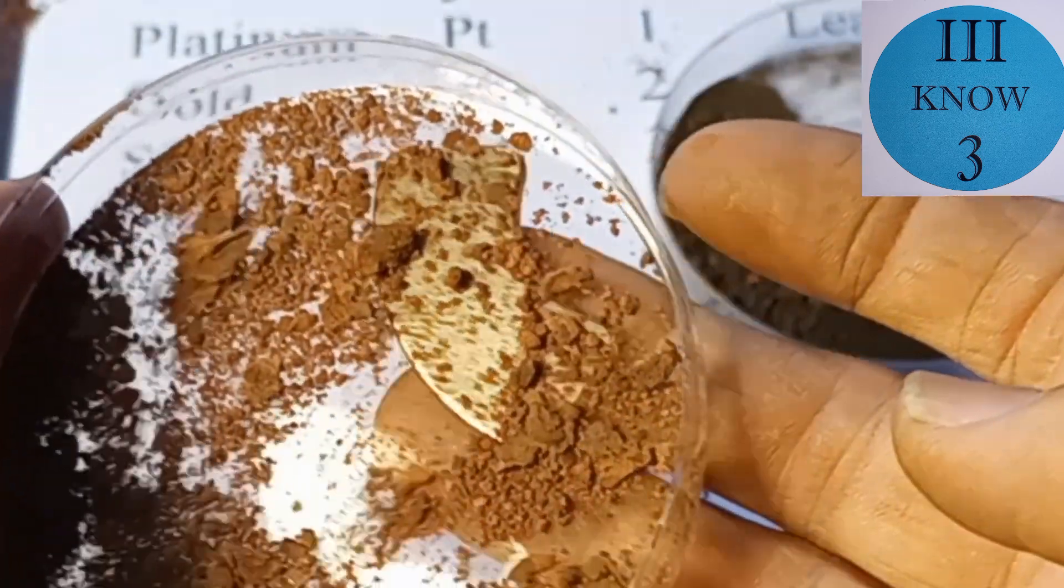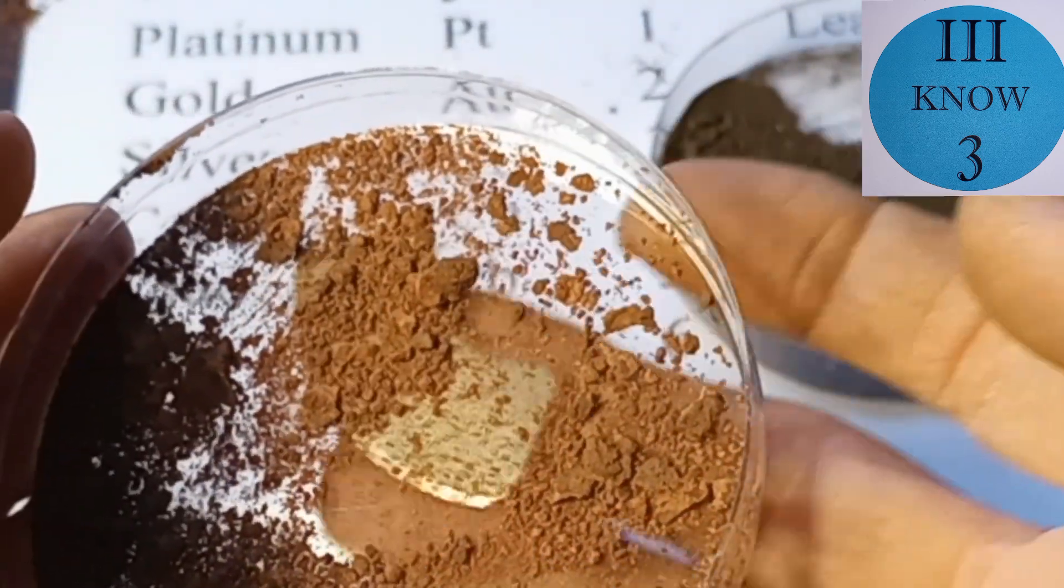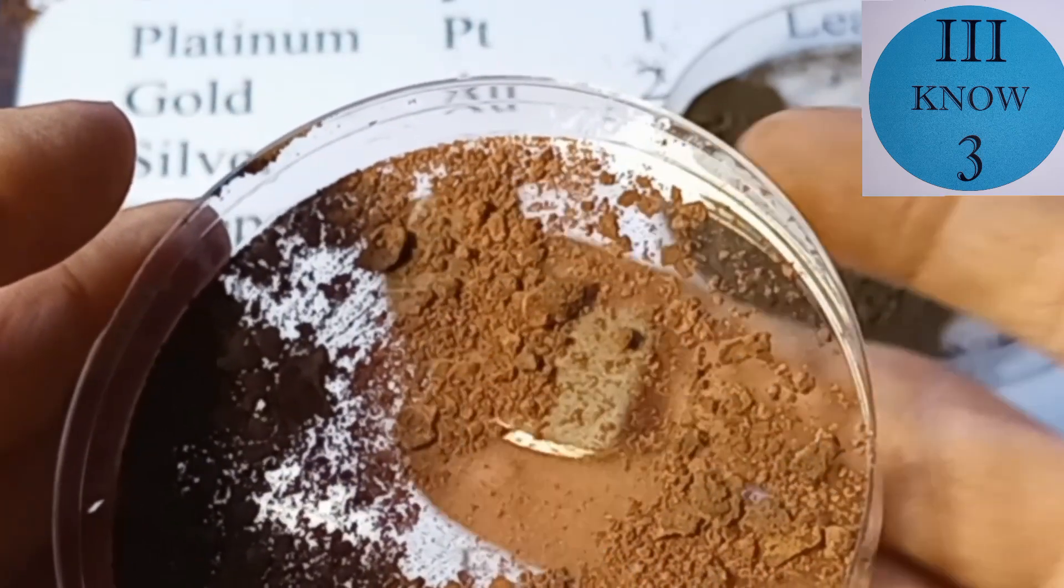And then this is the first of the copper that we pulled off and you can see nothing is following the magnet.